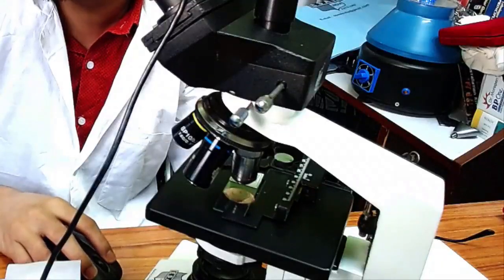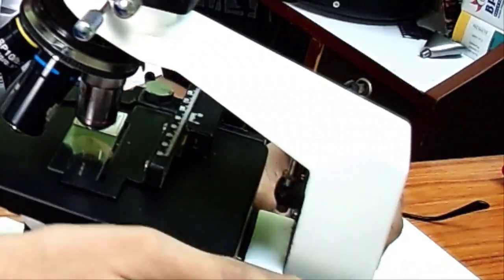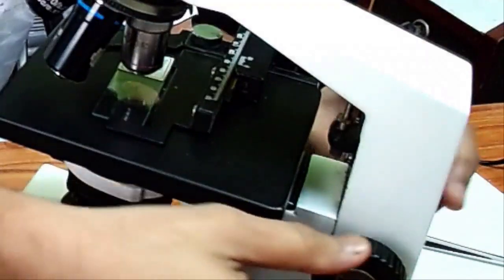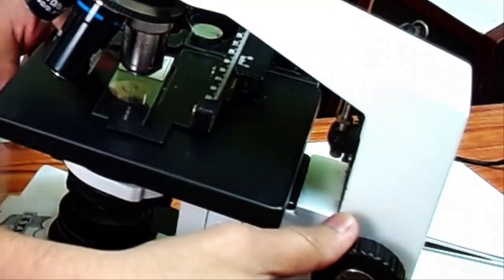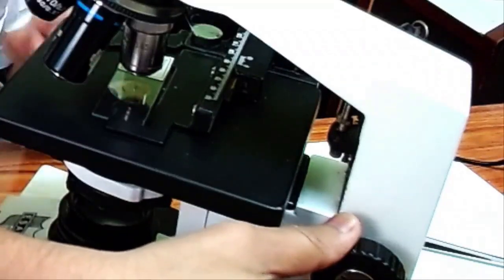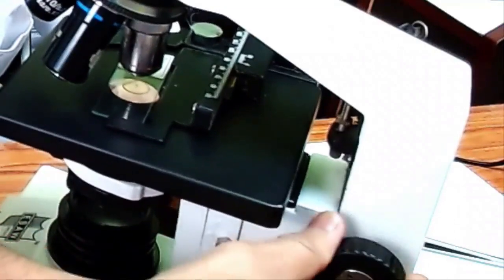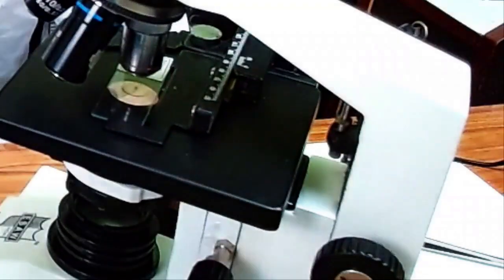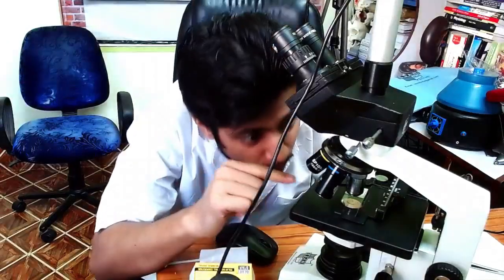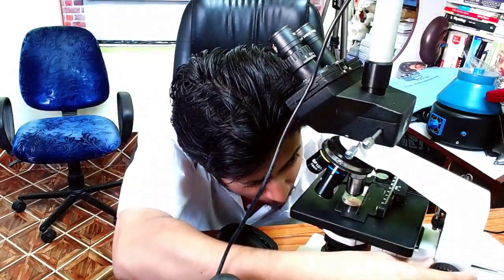What you should do instead: here is the adjustment screw. We are going to raise the stage by looking at the gap between the lens and the slide directly with your eyes — not through the eyepiece. You can see the lens and the slide here. We are going to bring the stage up like this, watching manually until the lens nearly reaches the slide.